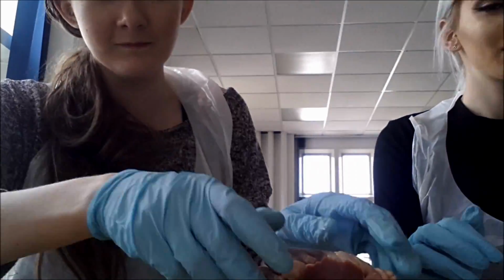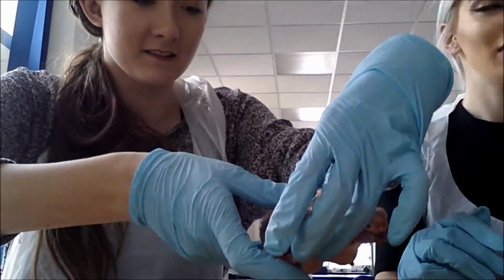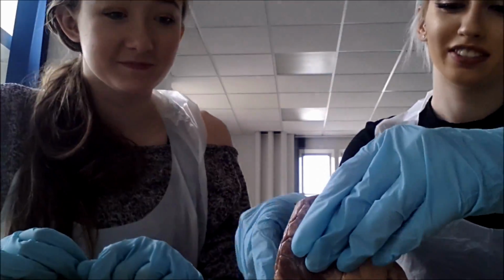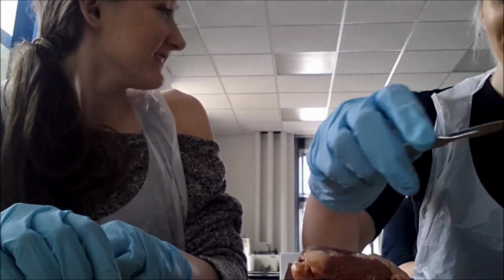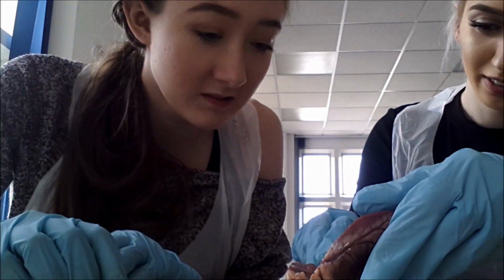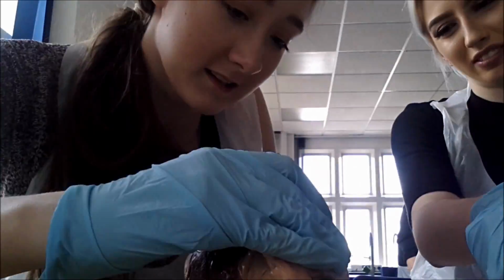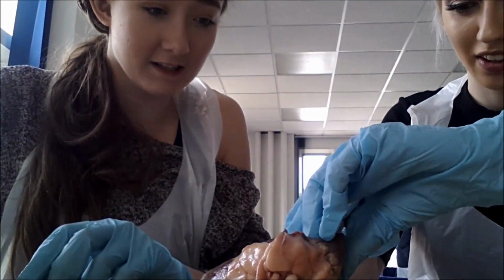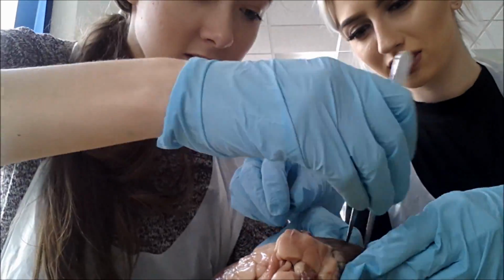Ventricles have thicker muscular walls than the atria, because when each atrium contracts, it only needs to push a short distance into each ventricle. The left ventricle has thicker muscular walls than the right ventricle. This is because it needs a much more powerful contraction to push the blood into the circulatory system. The right ventricle pushes blood to the nearby lungs, so the contraction does not need to be as powerful.